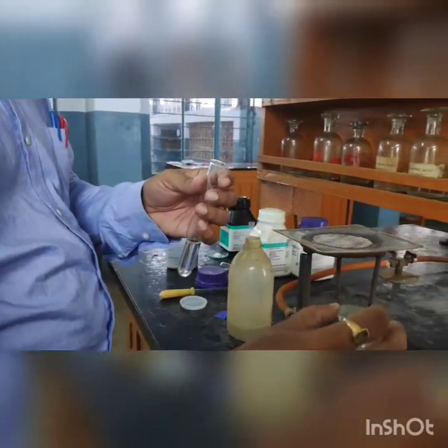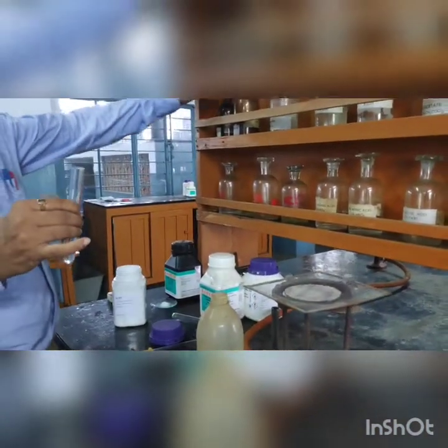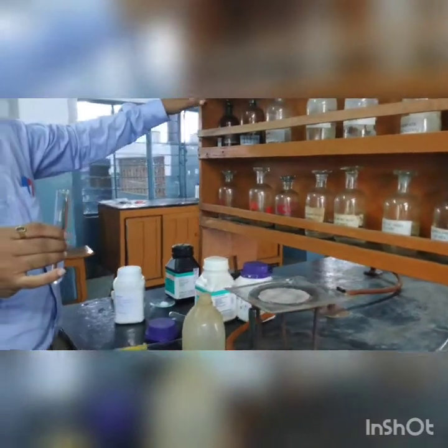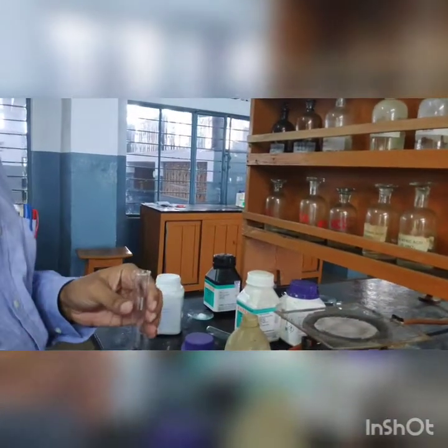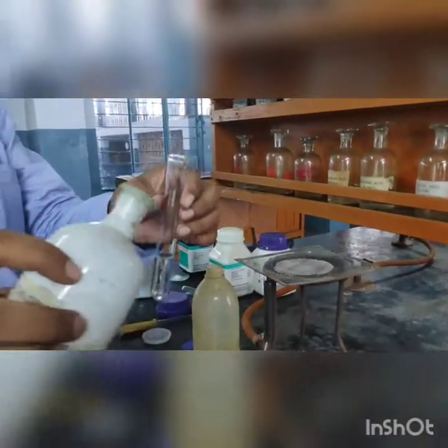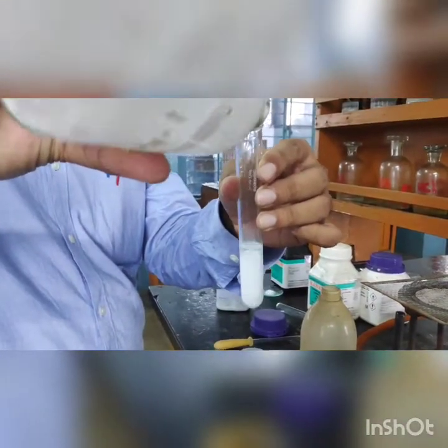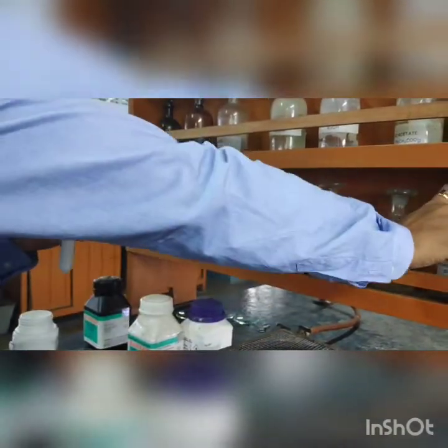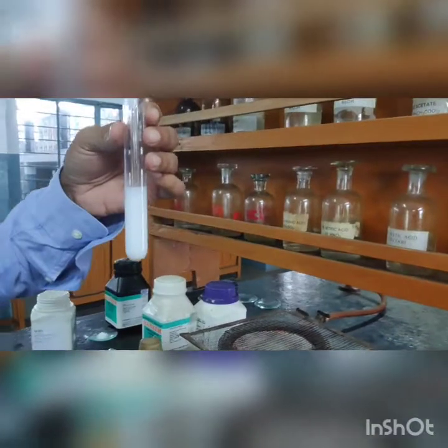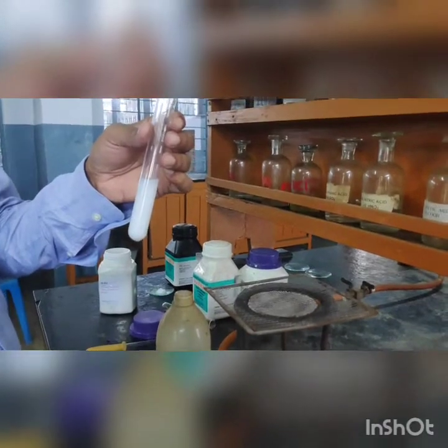Now that the filtrate has been acidified, the test for the sulfate radical is to add barium chloride solution, upon which a dense white precipitate will be obtained that is insoluble in any inorganic acid. You can see the dense white precipitate — since the medium is already acidic, we can confirm it is not soluble in acid either. This is the confirmatory test for the sulfate radical.